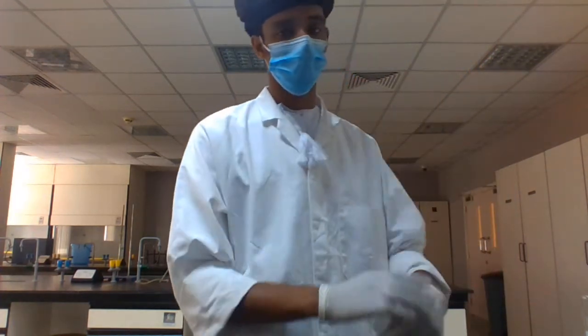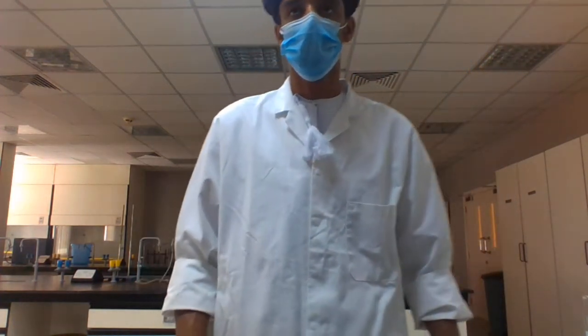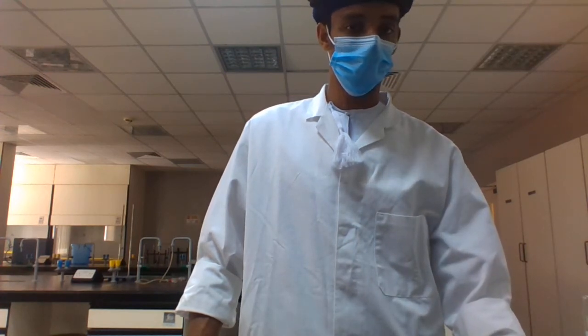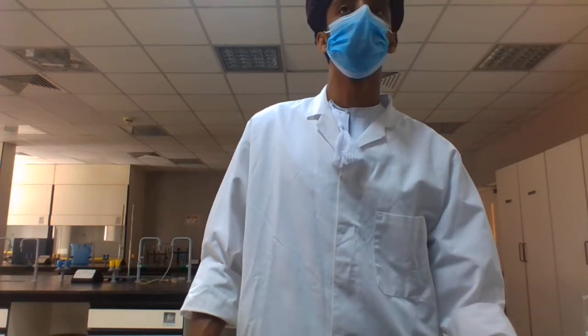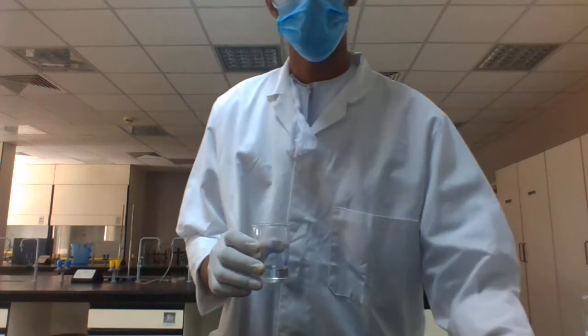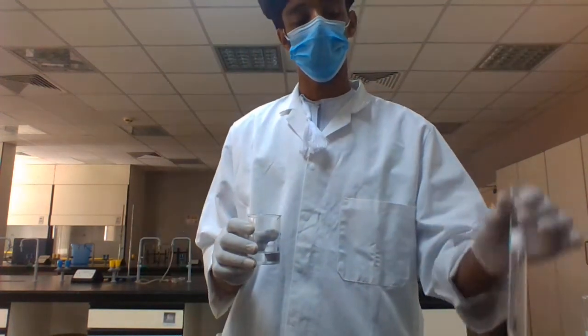Suppose we want to test for lipids. Then we have to take sample 1, and we'll test whether it contains lipids or not.